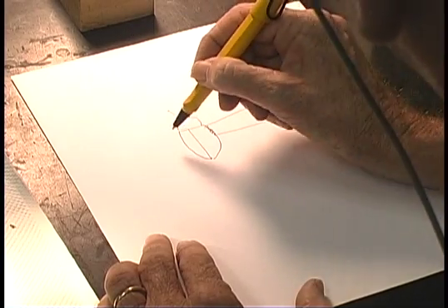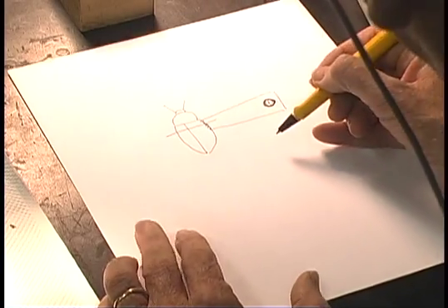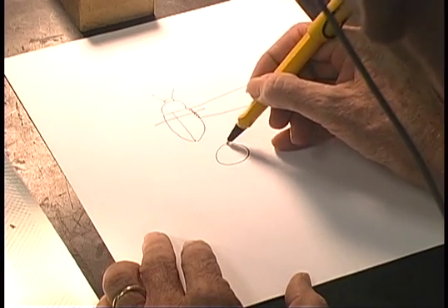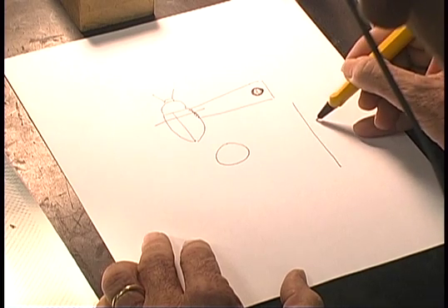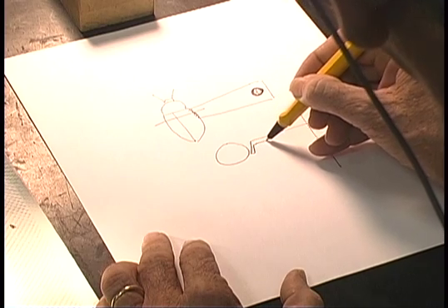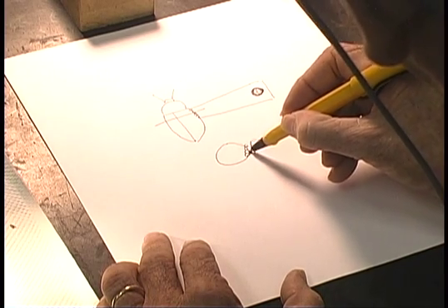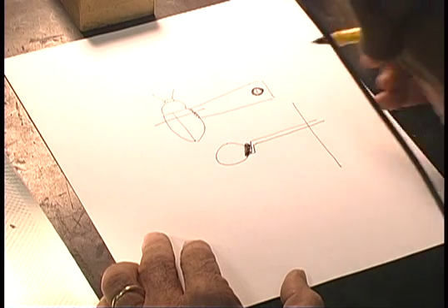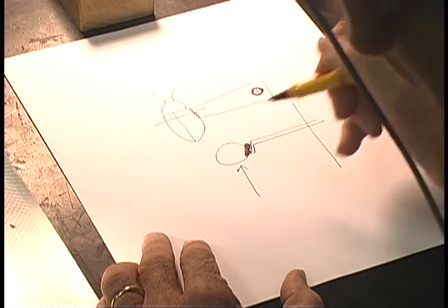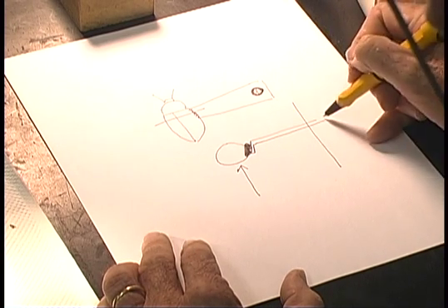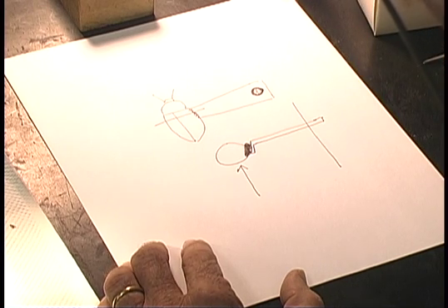Now, here's the most important thing. Imagine we take a cross section of that insect right there. The insect has depth. You want the point to come in and be bent down and attached to the actual side of the insect. This black spot here represents the glue. You notice that the midline of the underside is not covered up by the glue, and that's the most important aspect of point mounting insects, is to keep the midline clear.